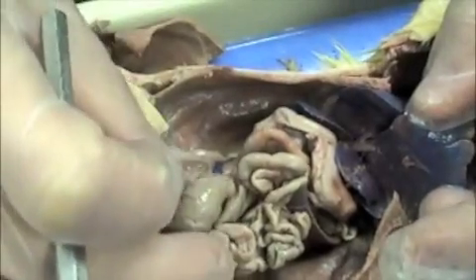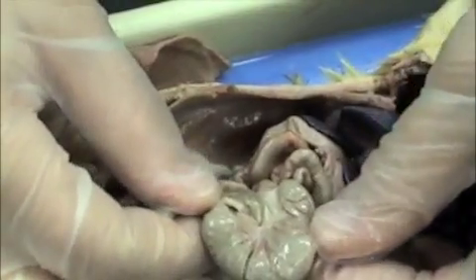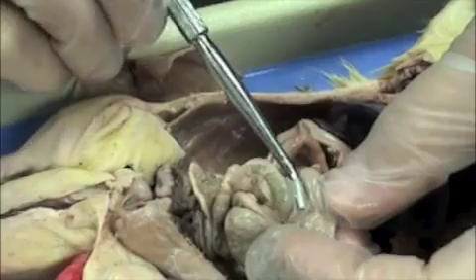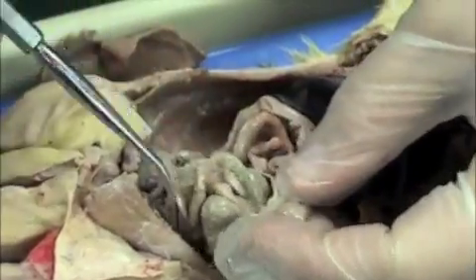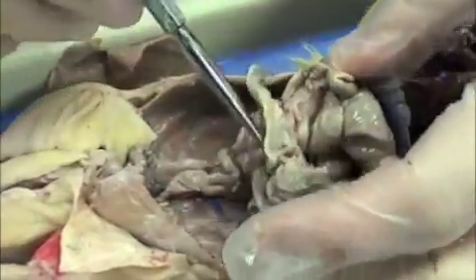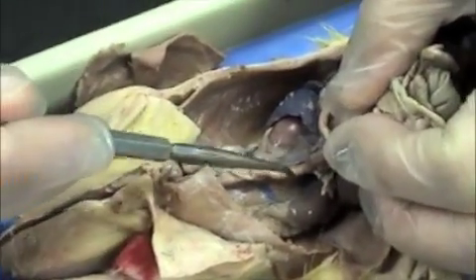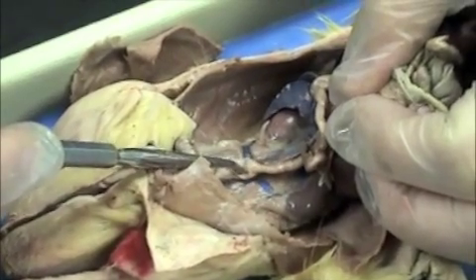Eventually the small intestines will come to the large intestines. The first part of the large intestines is the cecum — it's a big, large pouch right here. Some people say it looks like a second stomach. This is a really good example of mesentery here; you can see it's clear and it's holding the organs together. The last part of the large intestines comes down and leads to the rectum. This descending colon here — for your test, you would identify this as the large intestines.